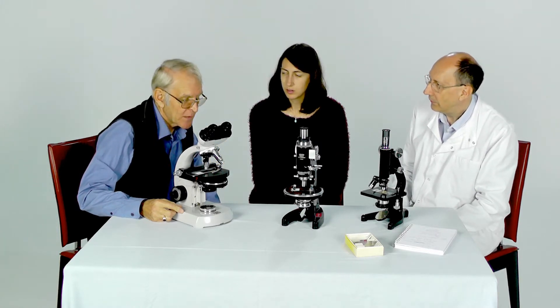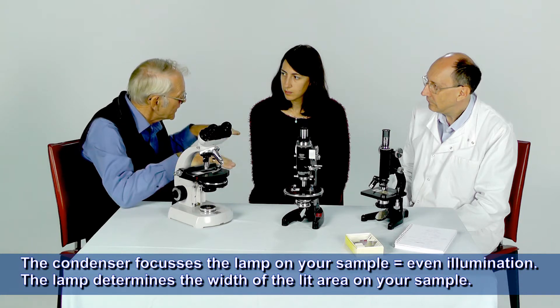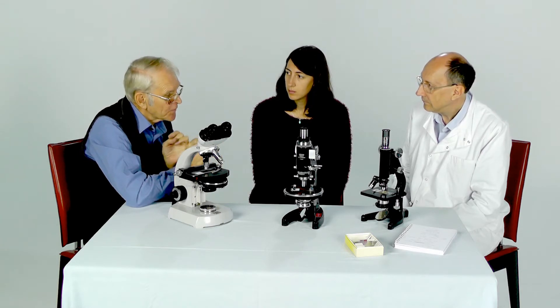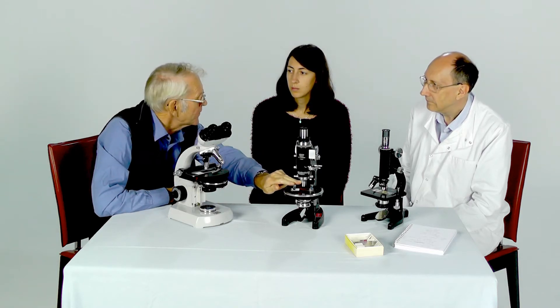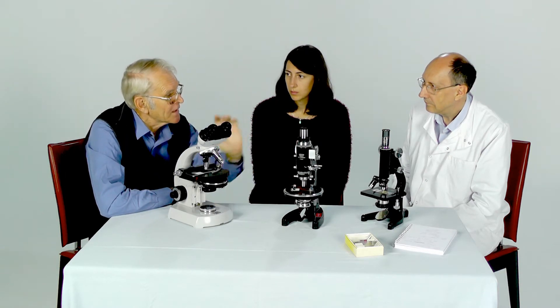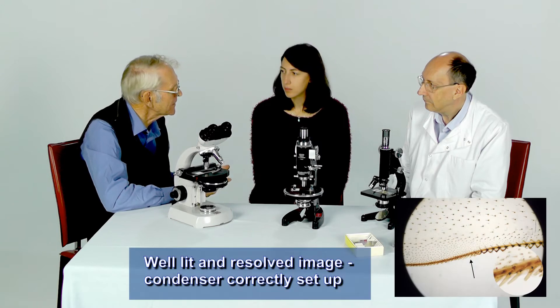And why is that important? What does that actually achieve? Initially, I would say there are three things you need to do to create a really good image to view. First of all, you have to extract the detail that you want to look at — that's to do with resolution, and that's controlled largely by the objective lens. You also have to magnify that detail to make it big enough to view comfortably, and it's the objective lens and the eyepiece lens working together that achieve that.